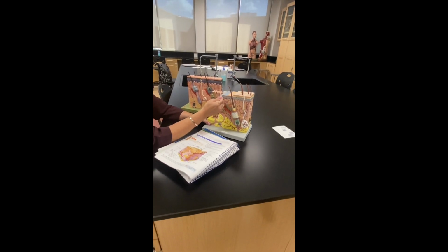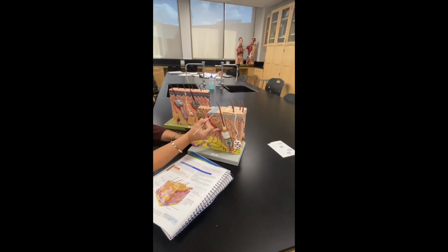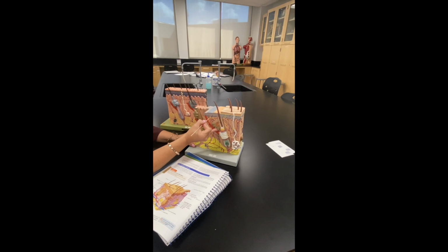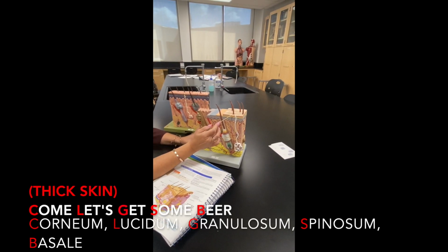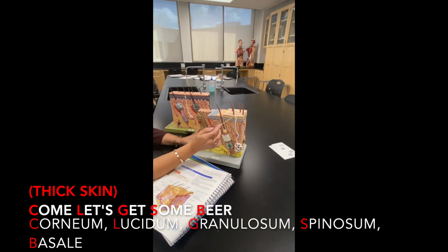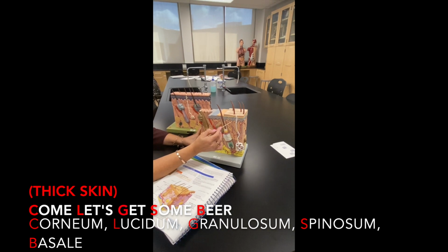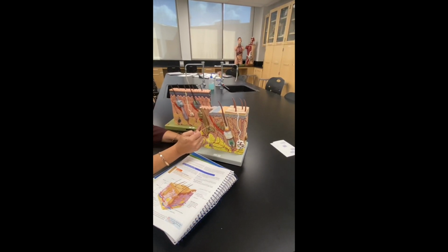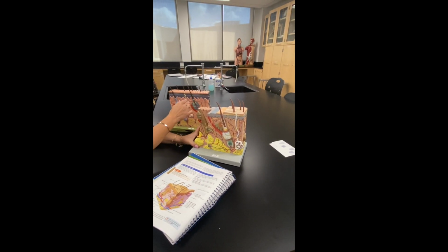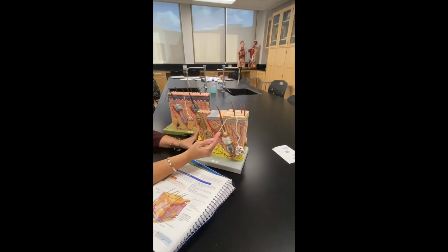This part here is thin skin. So I've got a stratum corneum, stratum granulosum, stratum spinosum, stratum basale. Here, I've got thick skin: stratum corneum, stratum lucidum, stratum granulosum, stratum spinosum, stratum basale. And again, you've got Meissner's corpuscles, Pacinian corpuscles, okay? But that one you see has a better subcutaneous vascular plexus, but this one has the free nerve endings.